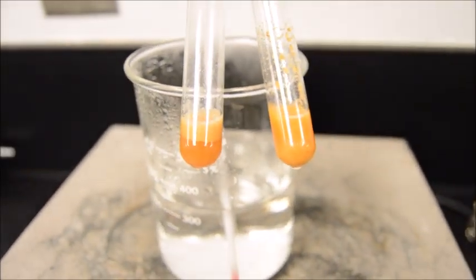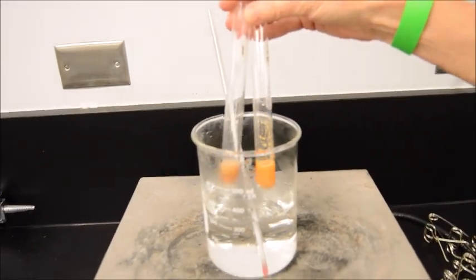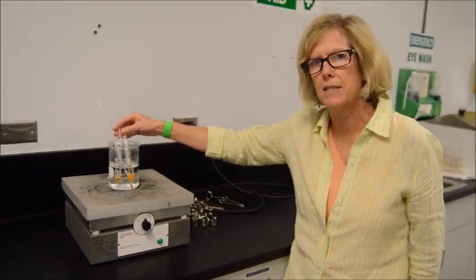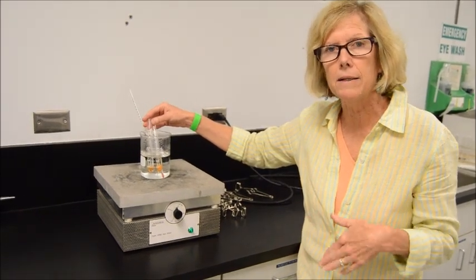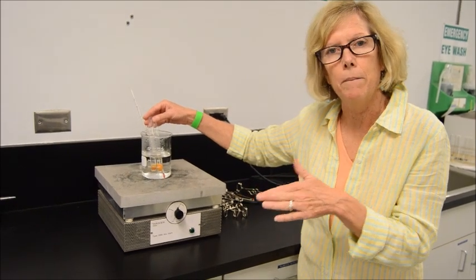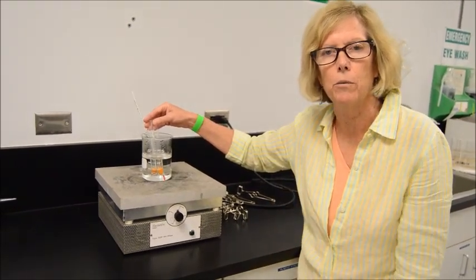All right. And that's what we've got for, which experiment are we doing? We're doing our food composition, our unknowns. And before we go any further, we should have said this in the beginning, excuse me, but you notice that they have you develop a hypothesis. So the idea is we gave you some consistency and smell observations, and based on that, what would you think these food substances would be? You don't get to make a hypothesis after you do the experiments. So before the experiments, what did you think those food items would be?